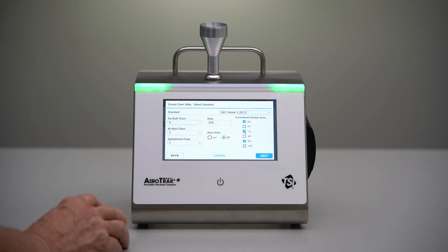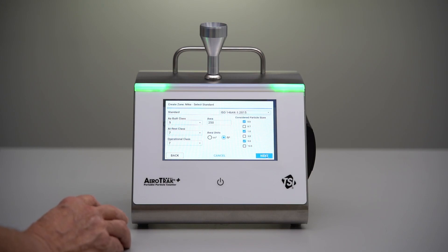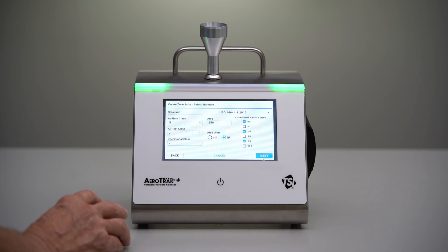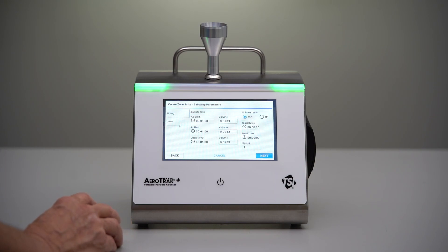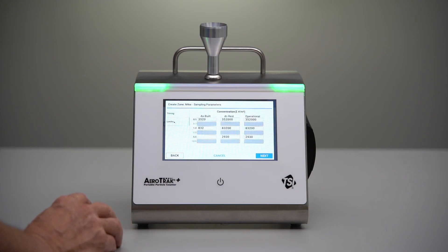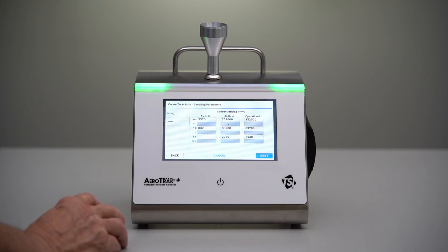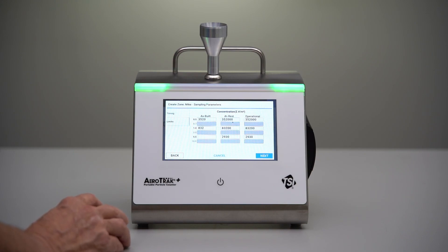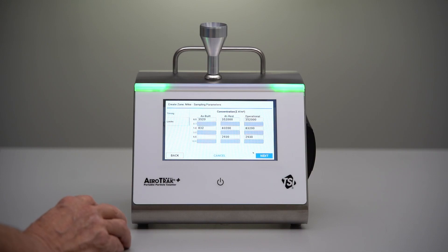We don't really need 1.0 — it's not used very much — but we'll leave it in there anyway just so you can see what the template looks like. The timing as well as the numeric limits based on the classes ISO 5 and ISO 7 are prefilled in the template.